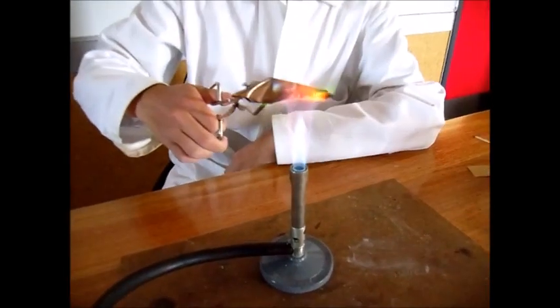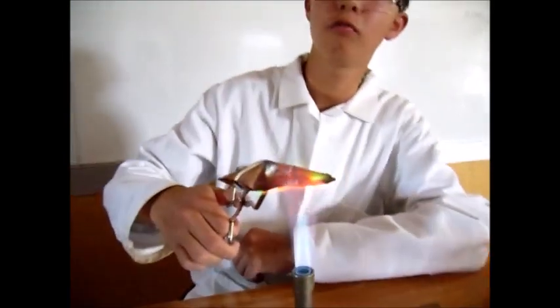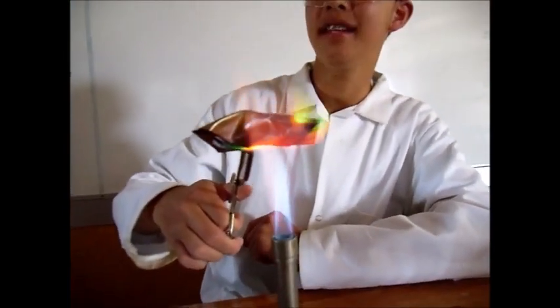However, it's not a boring 5 minutes. As you can see, the copper glows green as it burns. Since we've got a rather large piece, it actually may take longer.